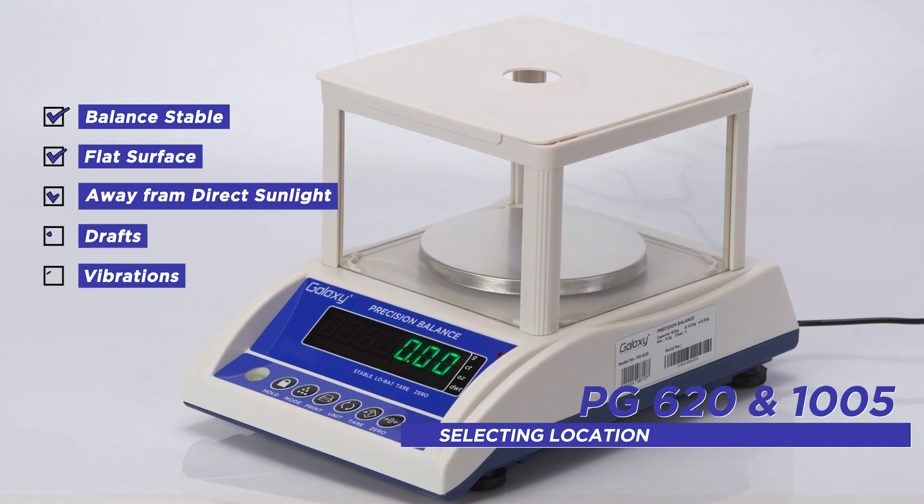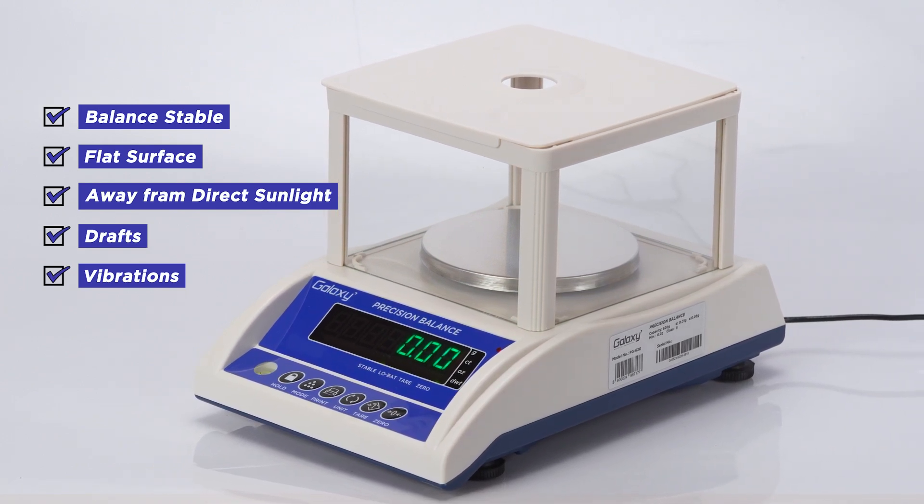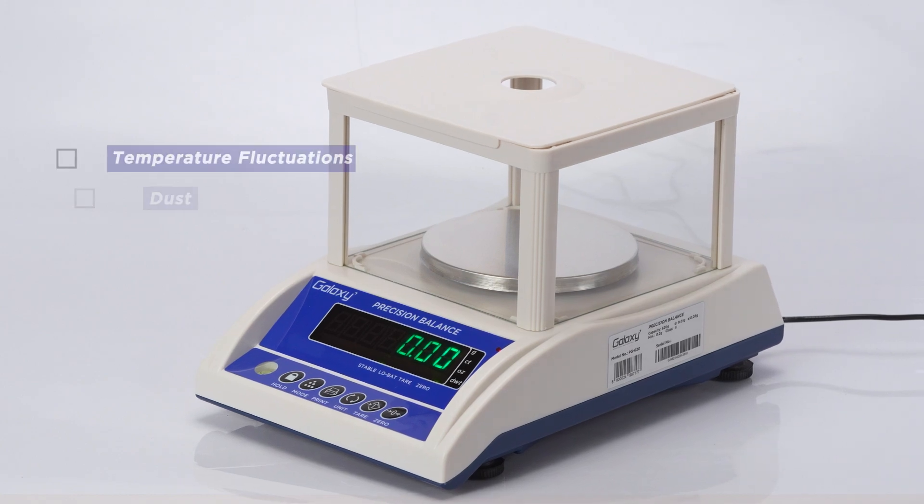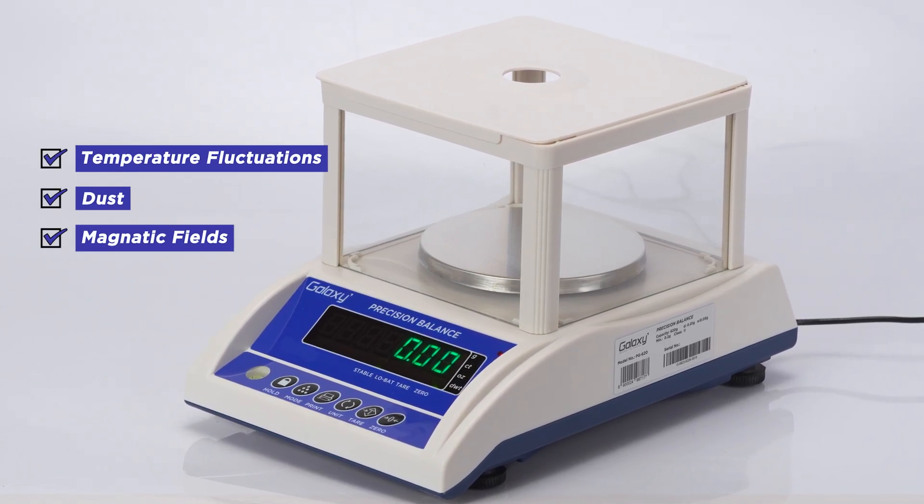Place the balance on a stable flat surface away from direct sunlight, drafts or vibrations. Choose a location free from temperature fluctuations, dust and magnetic fields.